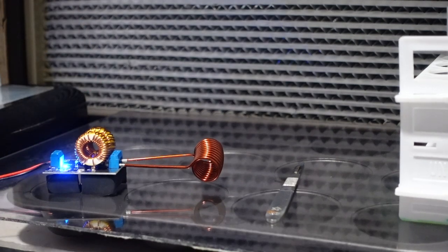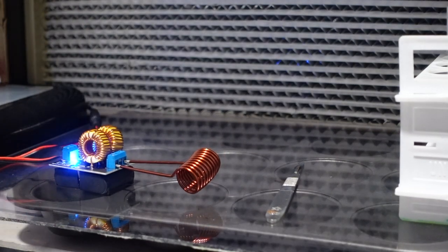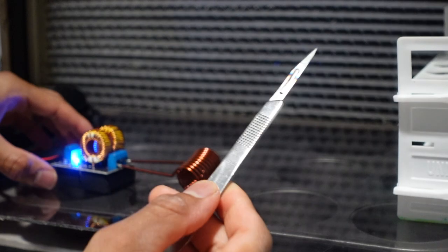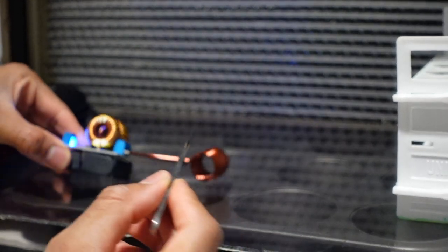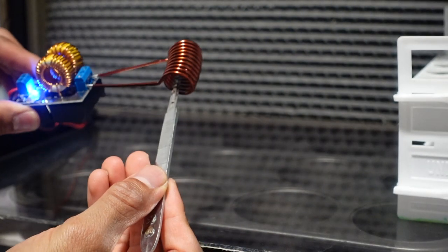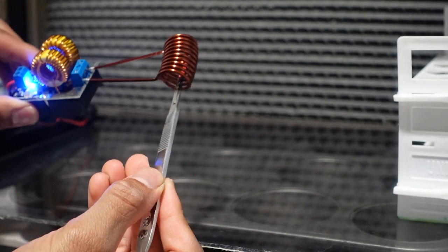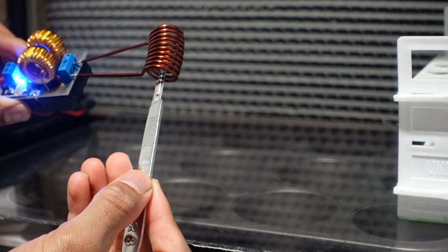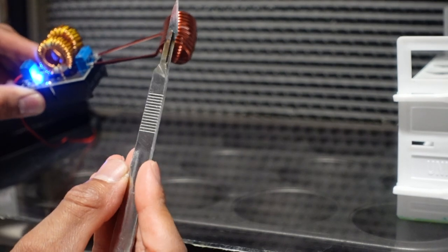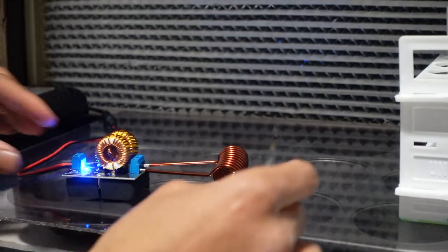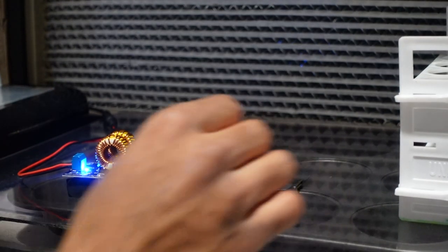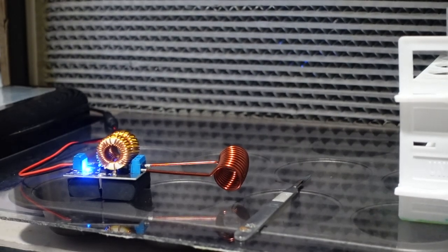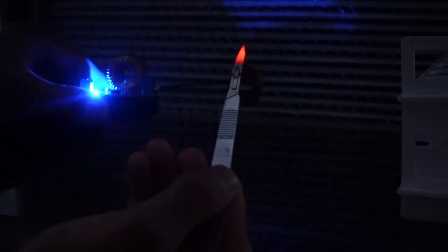Blue light comes on when it's receiving power. See that it's getting red hot in a few seconds? Let me turn off the light to show you how quick this thing is. See, it heats up fairly quickly. Put it back in right now.